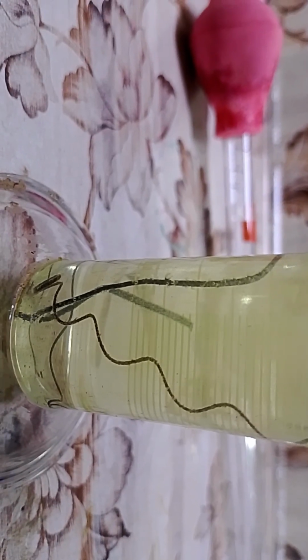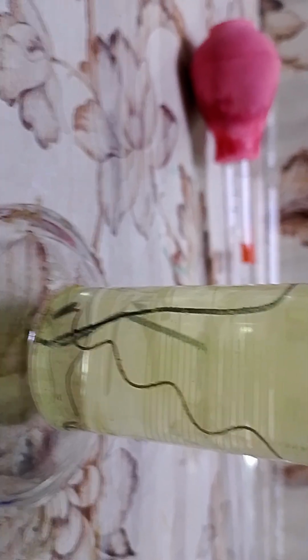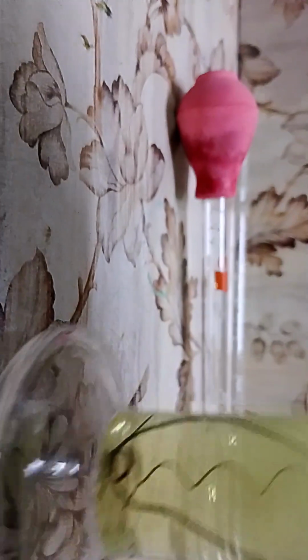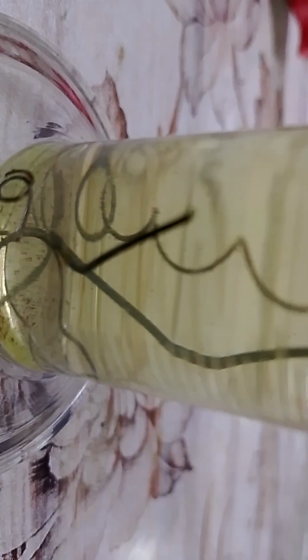Okay, so you can see hydrogen bubbles being produced by these iron strips. You can see a lot of gas being evolved. Can you? Let me shake it for you and let me focus it for you. See all that rising? Let me bring a closer look to one piece of iron that is reacting. Can you see the bubbles? It is all being done by Mr. Sulphuric acid, the king of chemicals, which we made.